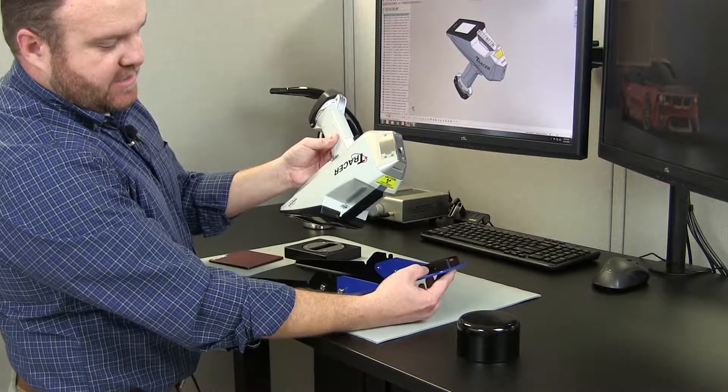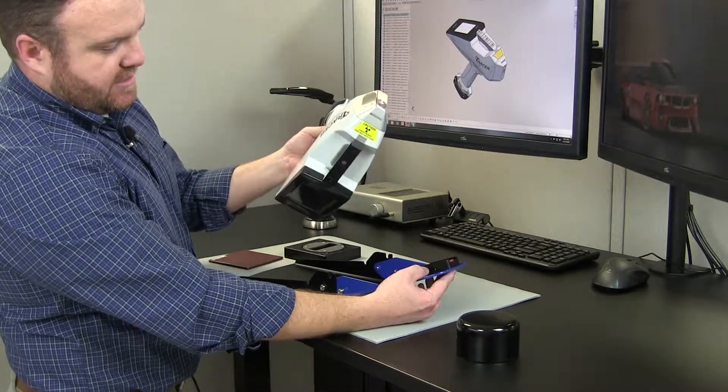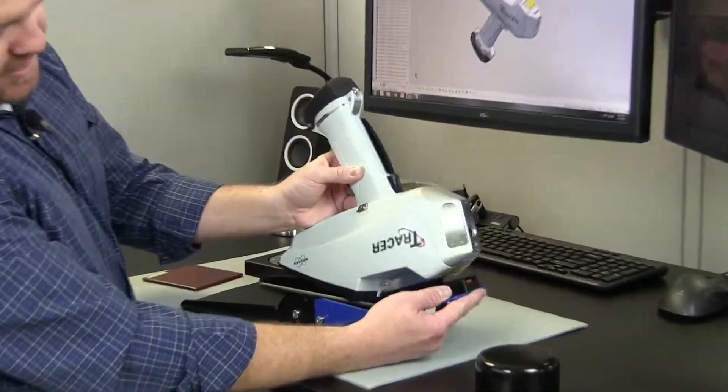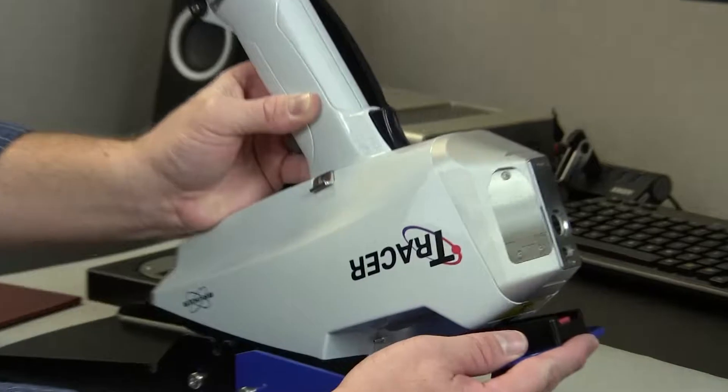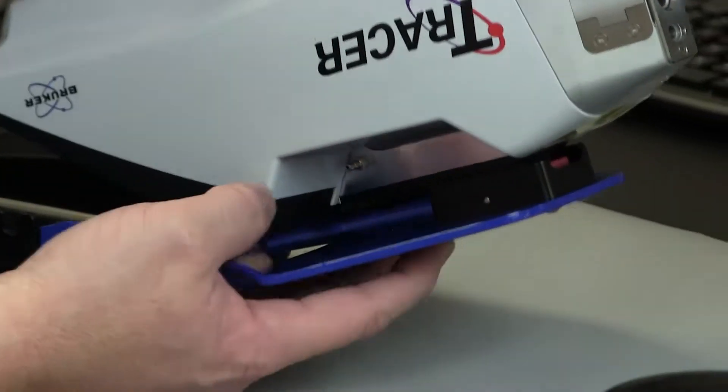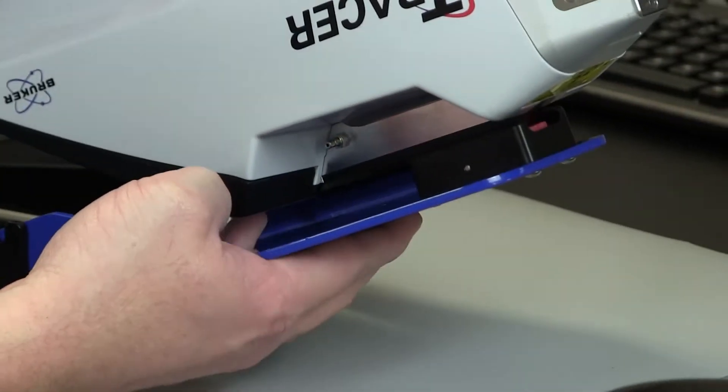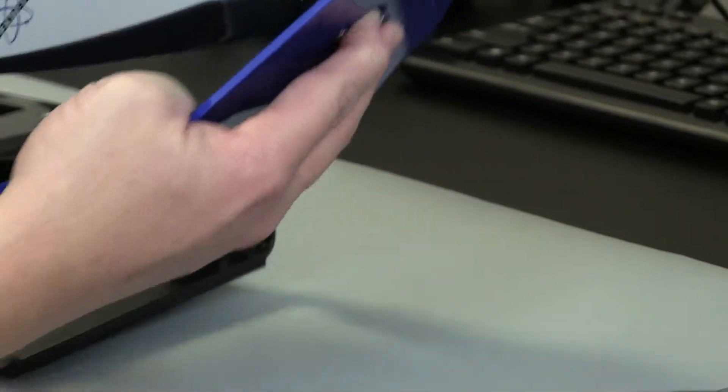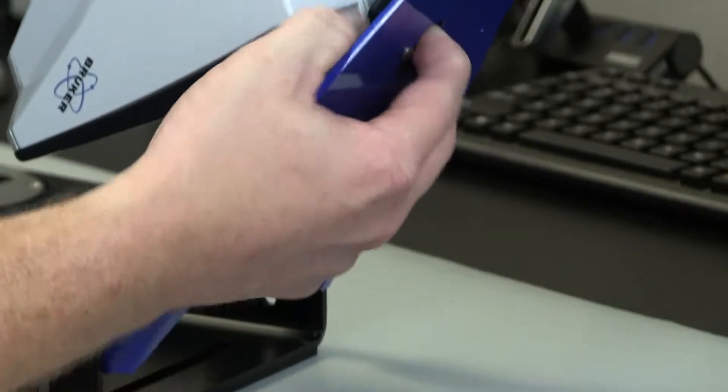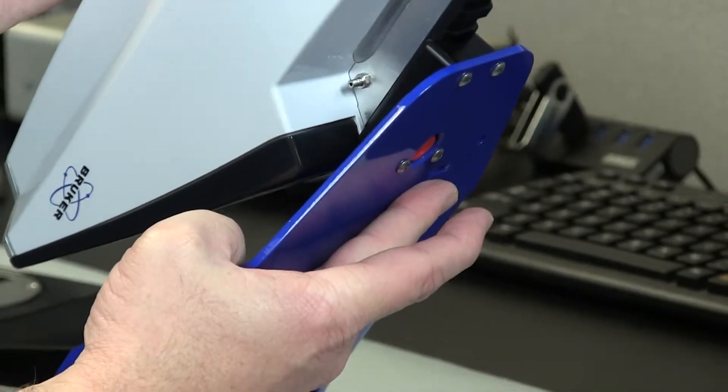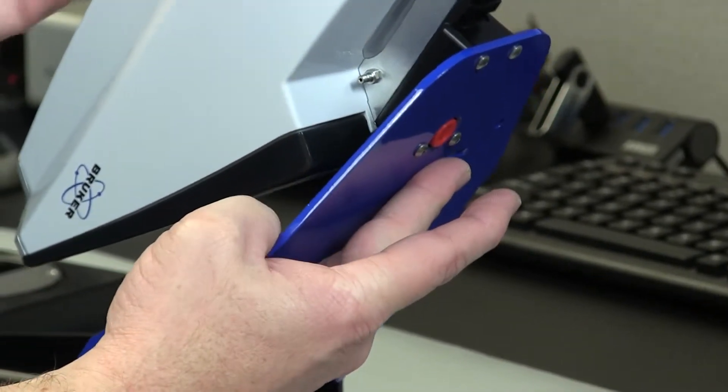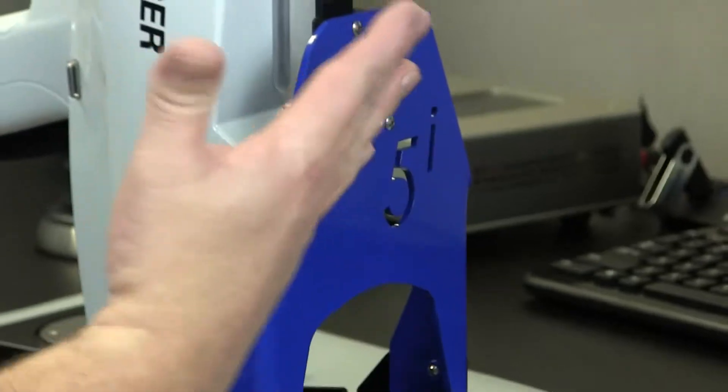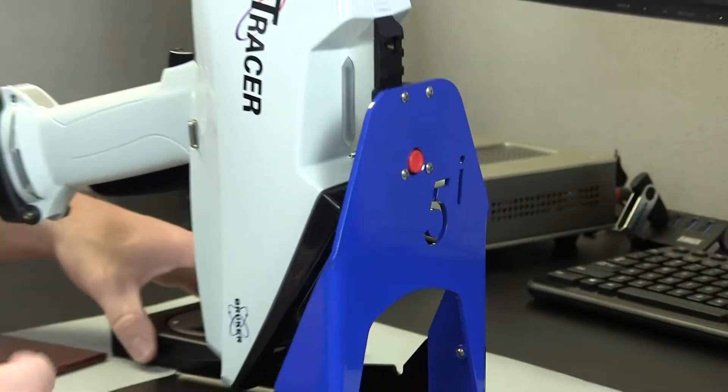There's a block here that's designed universally to accept our rail system. We slide it in like that, push and hold the button. The instrument slides all the way up, touches the bezel, and comes back to the first notch and it's ready to go in its nose up position.